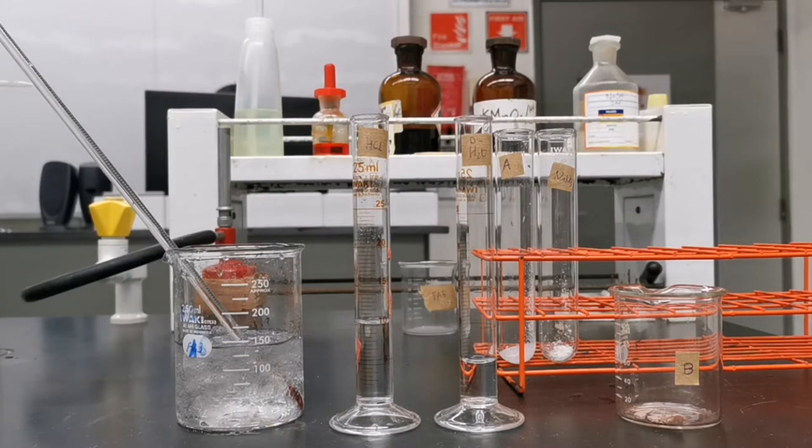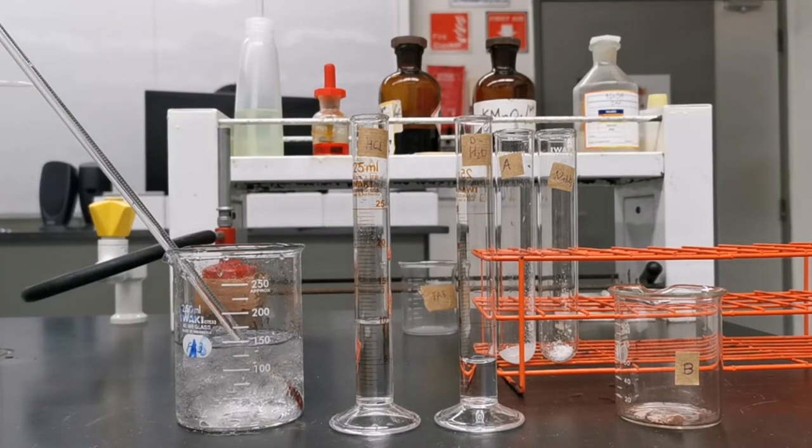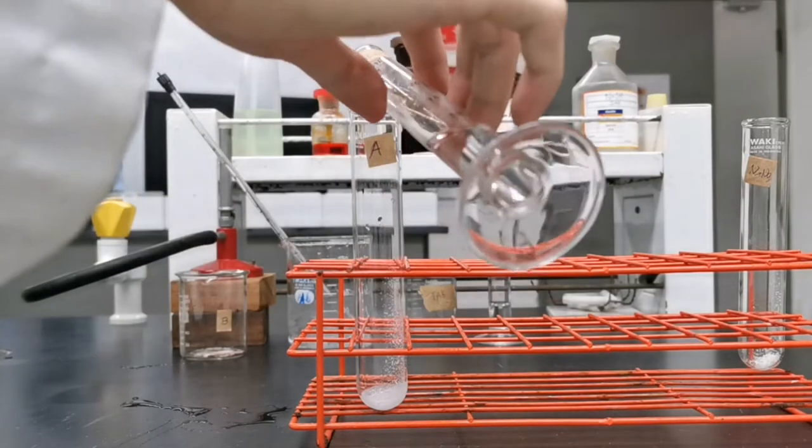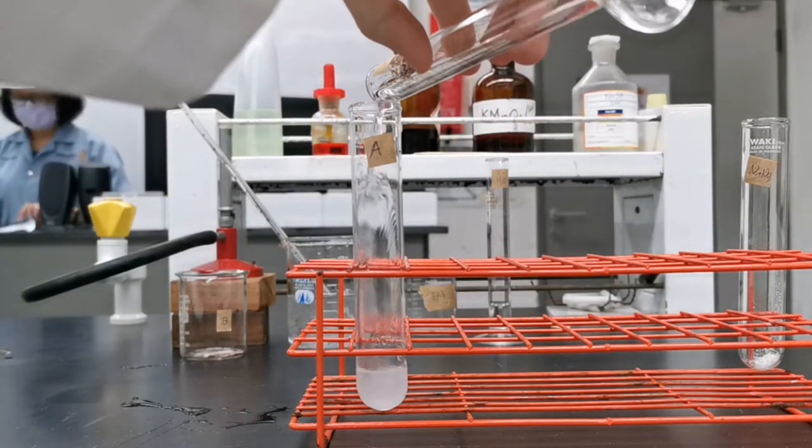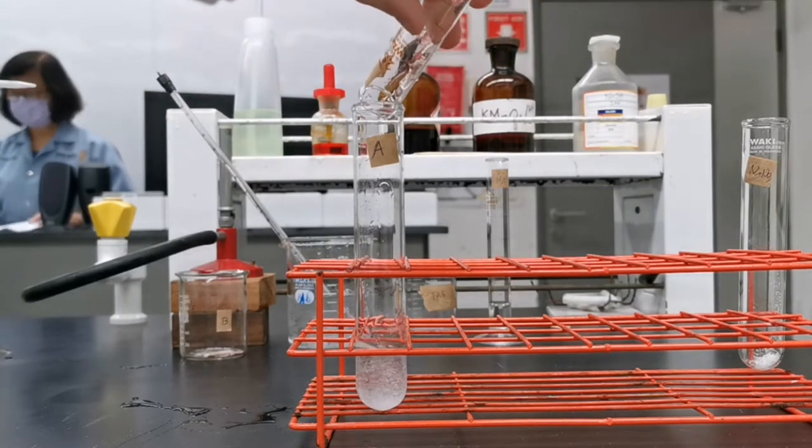To start off I pour in 10 mls of acid into the amino benzoate and stir to dissolve all of it.